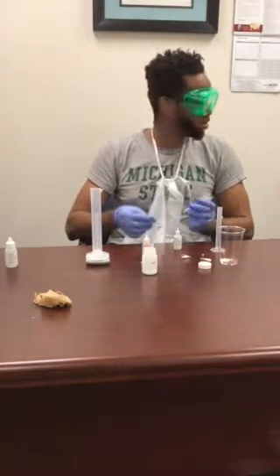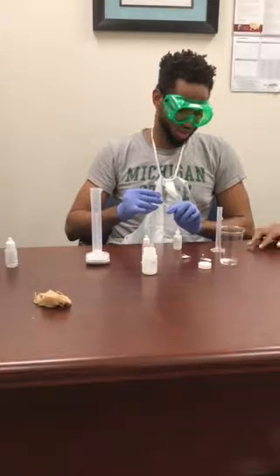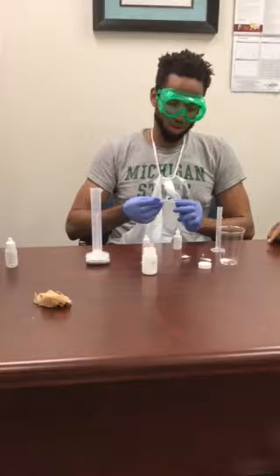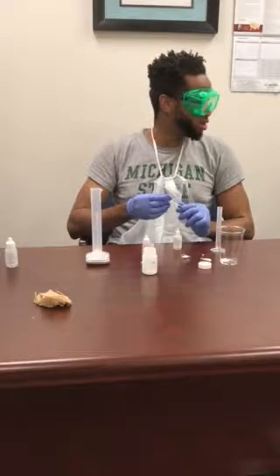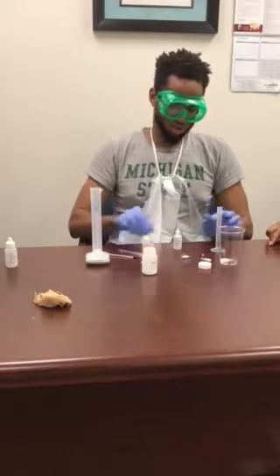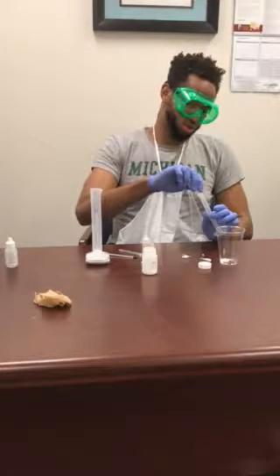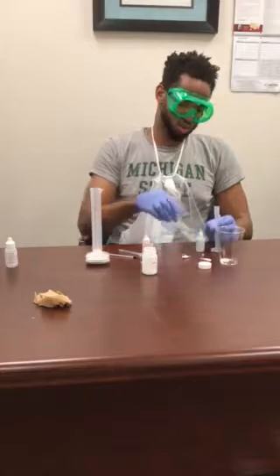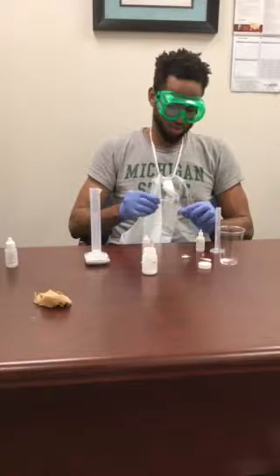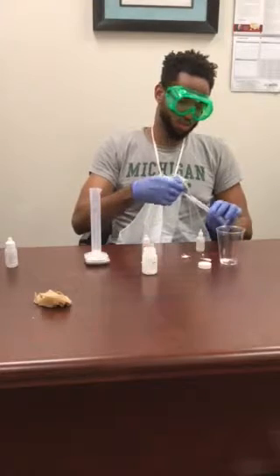But they want us to get the air out, so it might be better to put the syringe in there and grab some of the HCl that you put in there already. Wait, wouldn't it fall out? It might, so you might need to put a little bit more HCl in, just to grab a bit of it, because they don't want us to have any air in it. We should have plenty for the experiment. Then putting the syringe back together, drawing some at the bottom, and making sure there's no air in it, pushing all the air out.